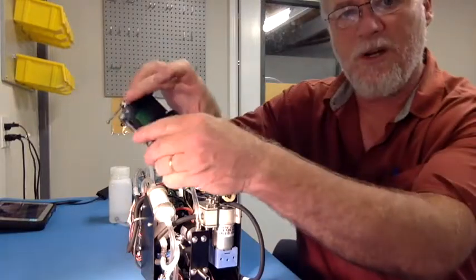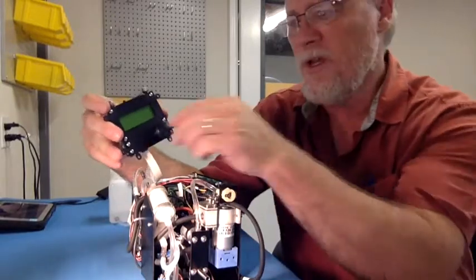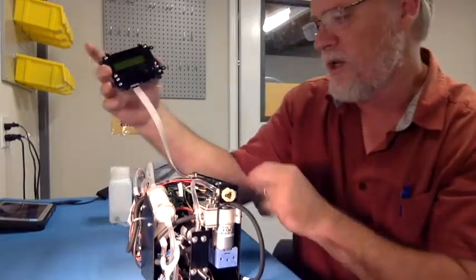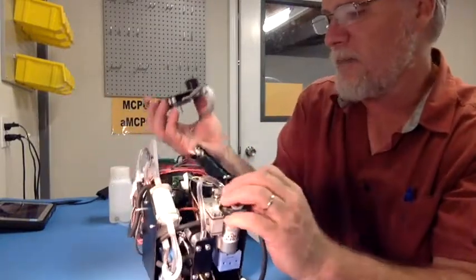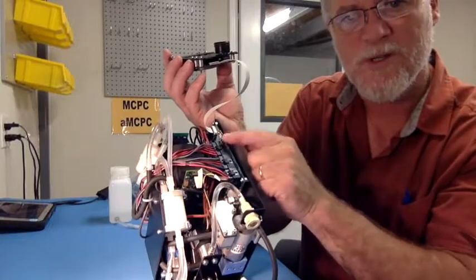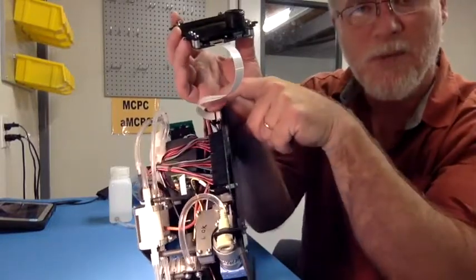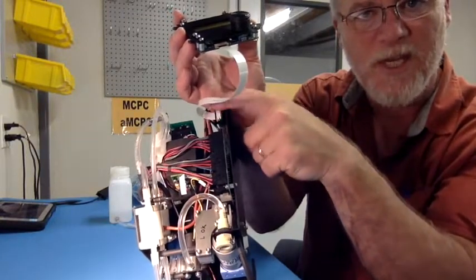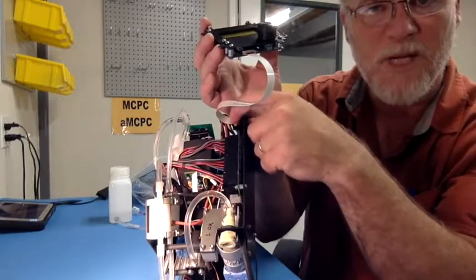You'll see here a front panel display. This is what you can use as your interface to see what all the instrument operating parameters are. You connect it here via a ribbon cable at the very top edge of the control board. This is the main control board here. And you'll notice that the cable has a black color on this face. That black color on the ribbon cable has to match with the brown connector clamp.